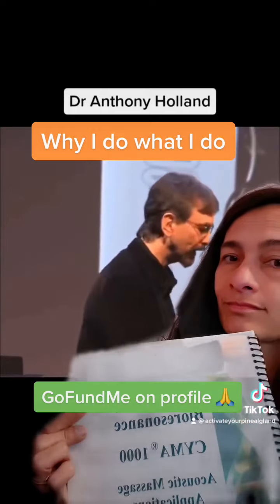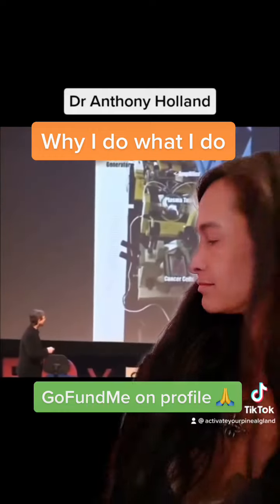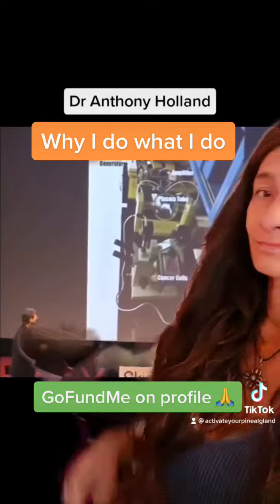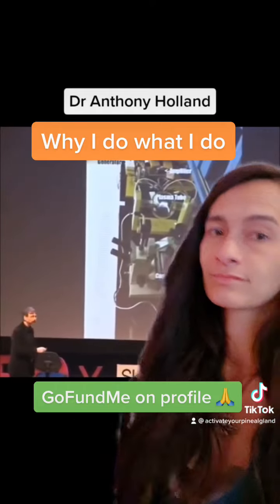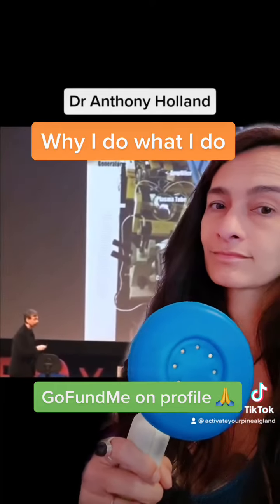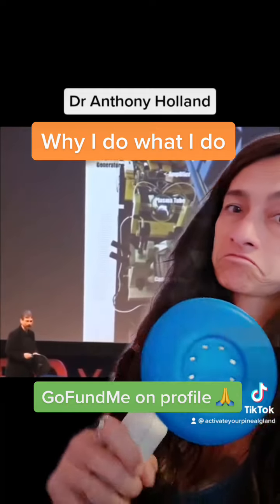This is our setup in the lab. You can see the microscope with cancer cells on it, the plasma tube, and my little frequency control box.